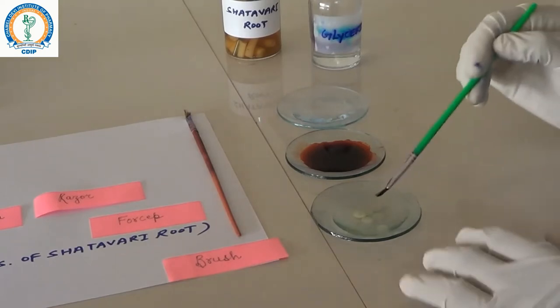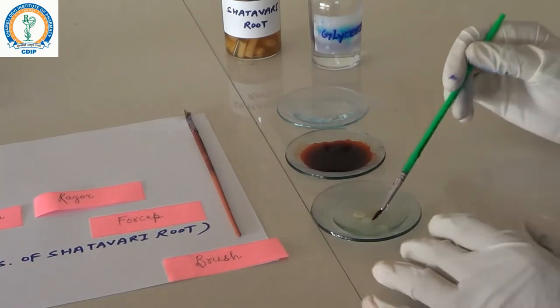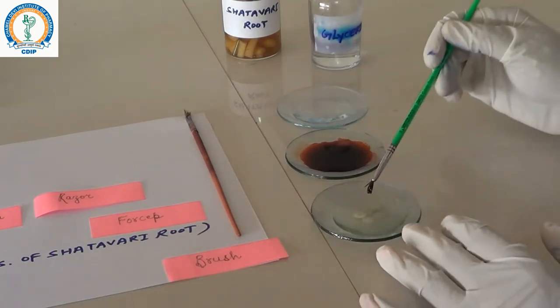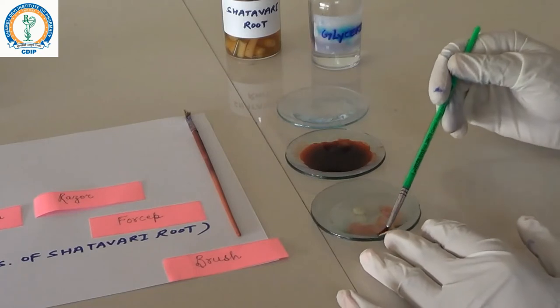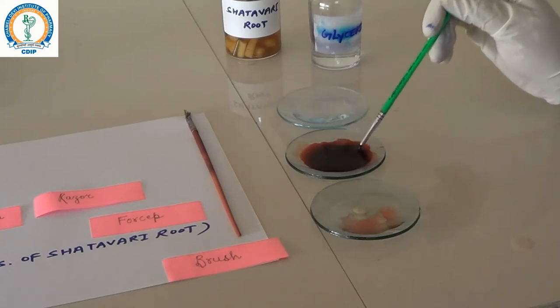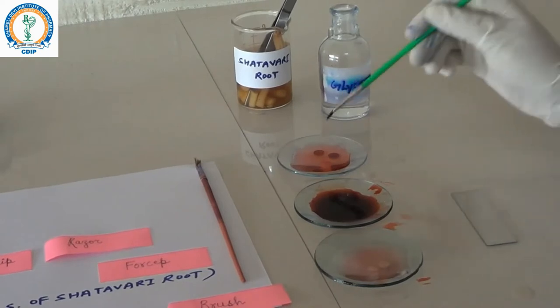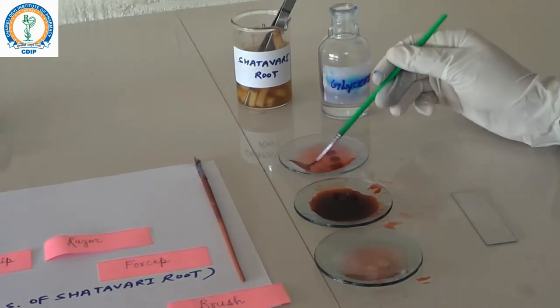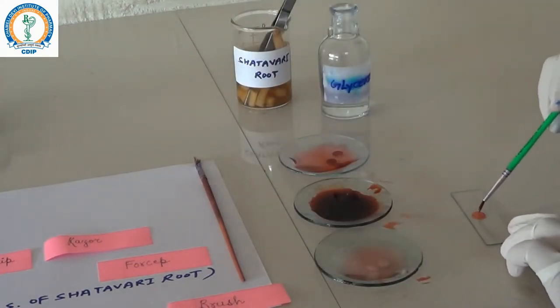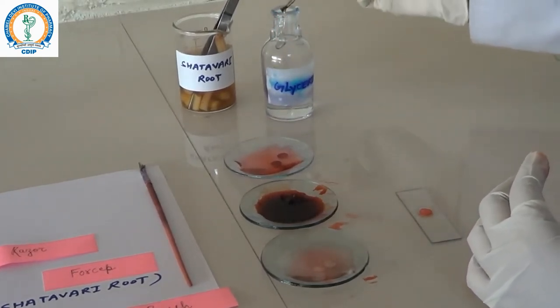After that, we transfer this very fine section into safranine dye for staining, and then transfer it onto the glass slide. Then we add one to two drops of glycerin for moisture content.